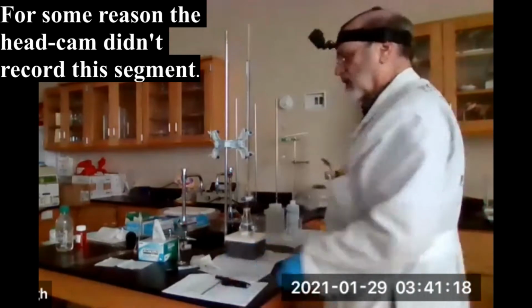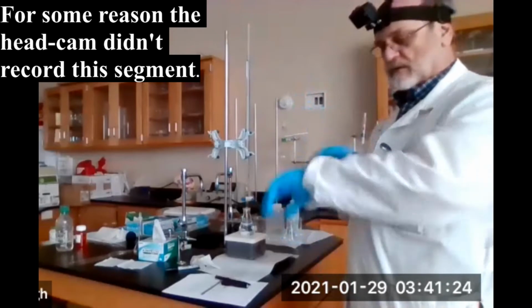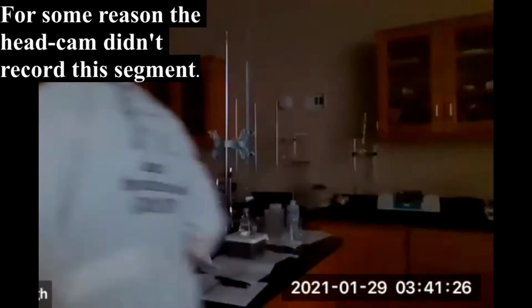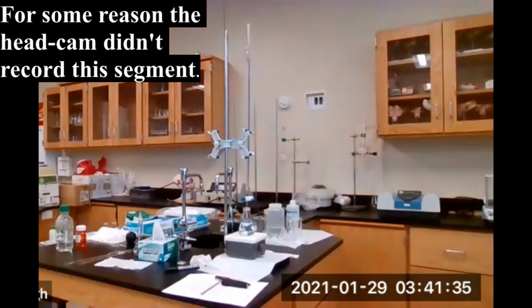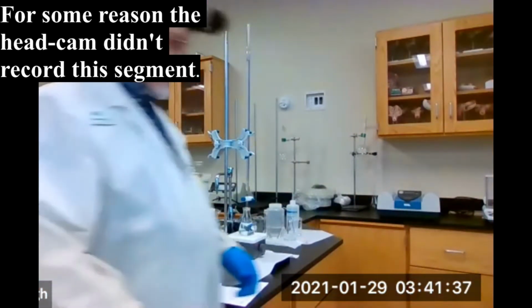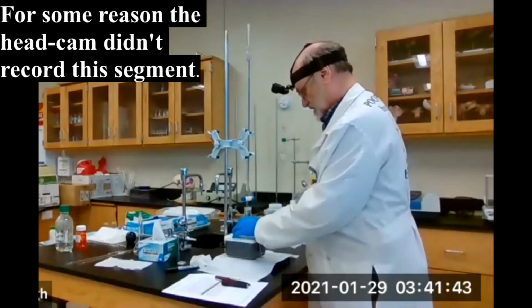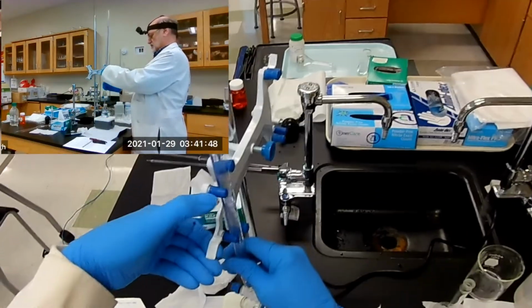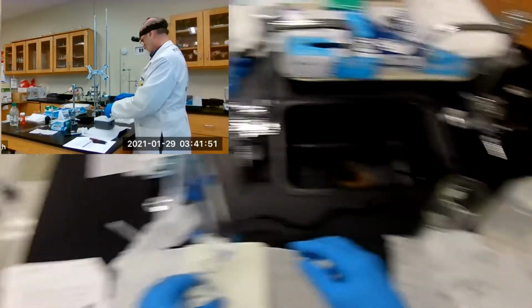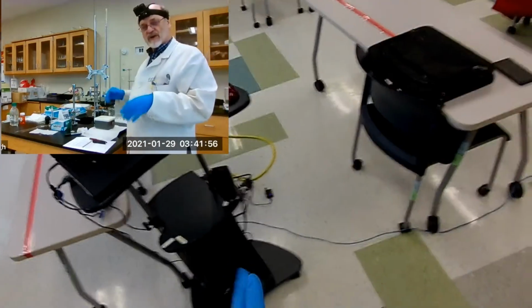Okay, let me turn the lights back on, and then we'll record our data and see what else we have to learn from this procedure. Okay, I think we're done here. Turn it off. Oops, we're gonna have to move this up some. There we go. Now, I'm gonna leave that there for now so we can finish this up and I can close the video out, and then I'll just do a cleanup.